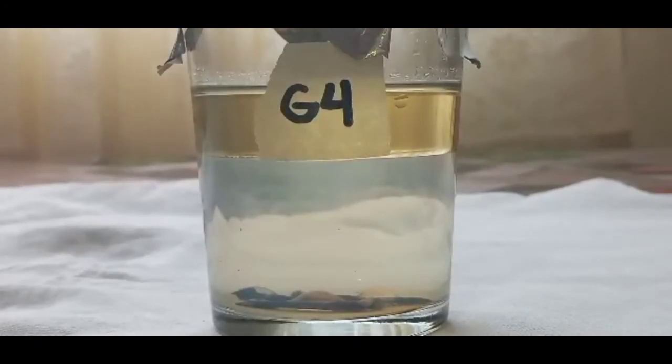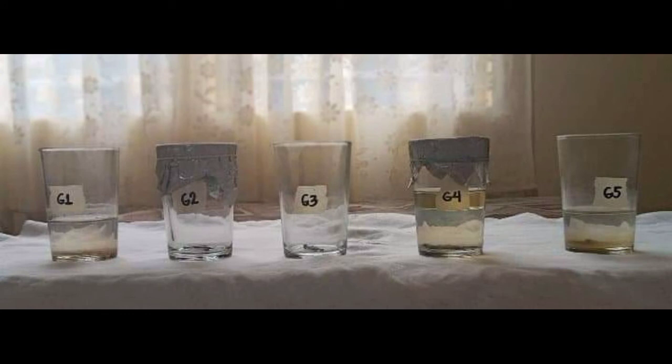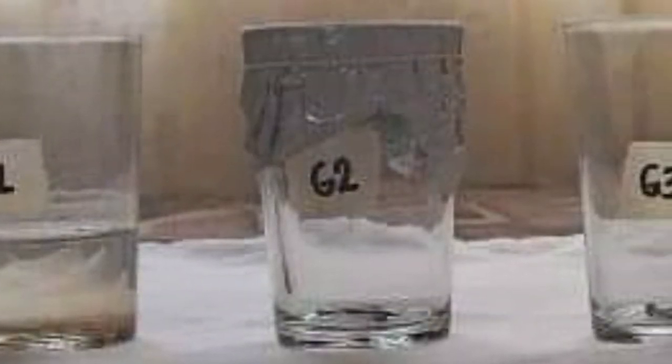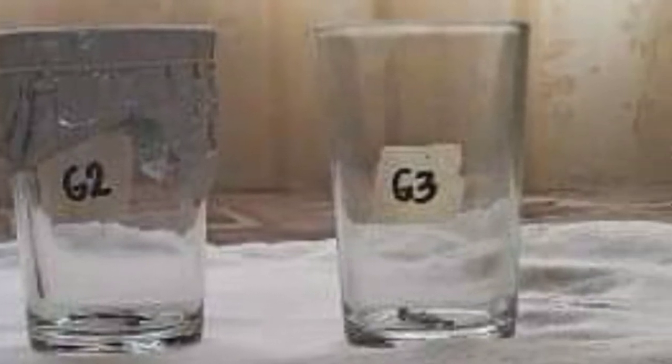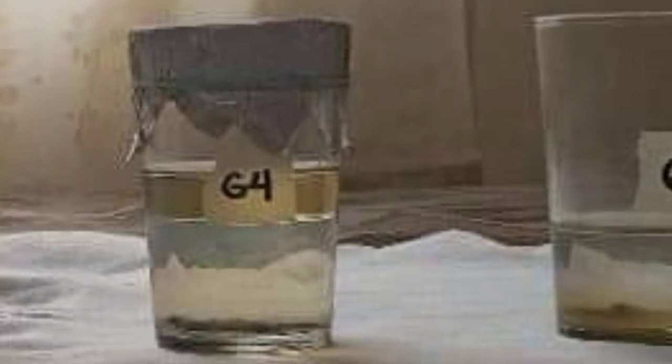While in glass number 4, the nails were coated with oil, preventing its corrosion. And in glass number 5, which has the highest rusting and discoloration of liquid medium, this is because of the salt or the sodium chloride was added to the water where nails were placed, creating a reaction. This increases the ions of water and the level of corrosion to the nails. This setup is uncovered and is exposed to the air. And considering the fact that the location where the experiment was conducted is near the sea, therefore the exposure of nails to water and air will take effect and create reaction that contributes to its rusting. As the nails aren't exposed to any influences, no reaction or occurrences of rusting. Also, the presence of oil can be a preventive material in some or certain cases of corrosion.